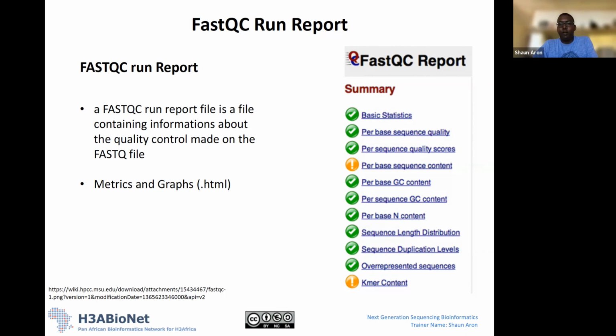Okay, so now what I'm going to do is run through the FastQC report file. This is a report file from an example dataset that's been run, and this example dataset is available on the FastQC webpage. I'm going to go through each of the quality metrics that are produced based on your QC file, on your FastQ file.